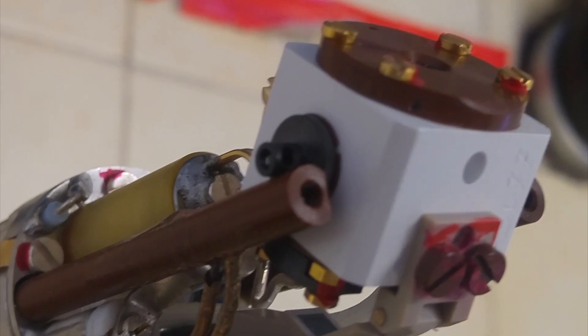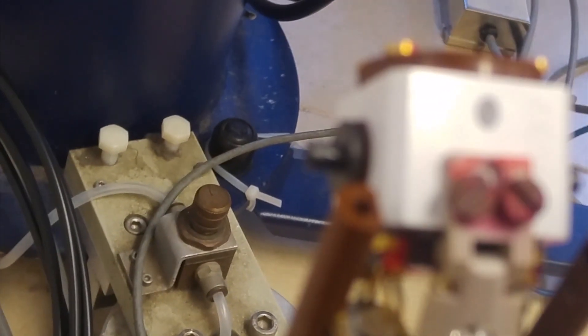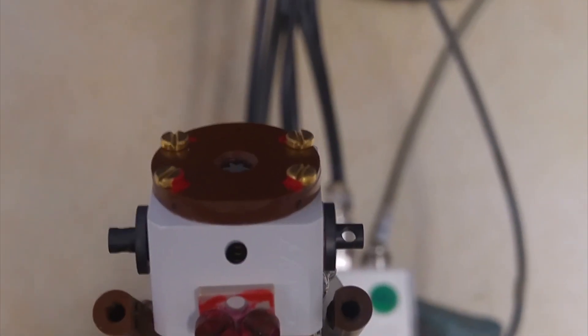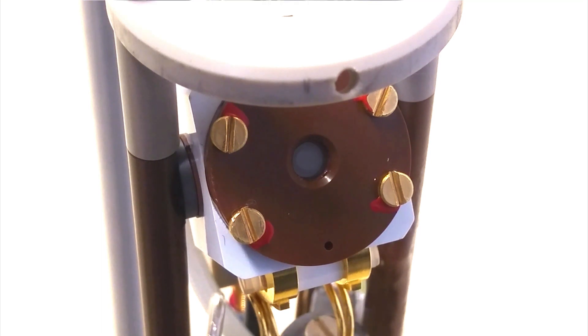On the sides, you've got these two pieces of black things, and we have to make sure that the holes are in the right direction. I can twist it around in such a manner that it blocks the flow, and then it won't work. So, if it blocks the flow, it won't work, but if it's allowing the flow through it, it will work. So, we'll give it a shot. So, on the left, the flow is blocked. On the right, the flow is hopefully working. We'll see. We'll set it to 5000 hertz.